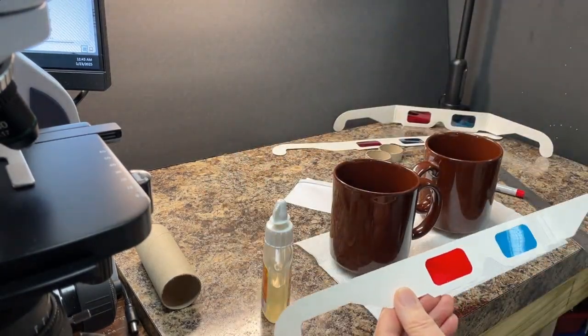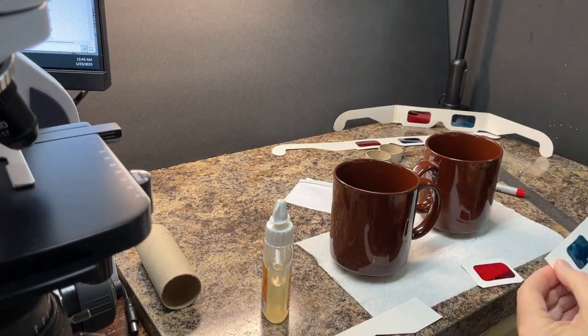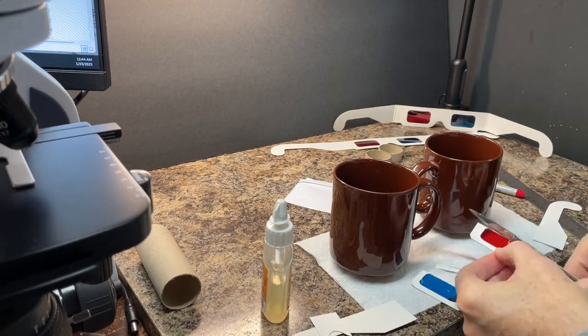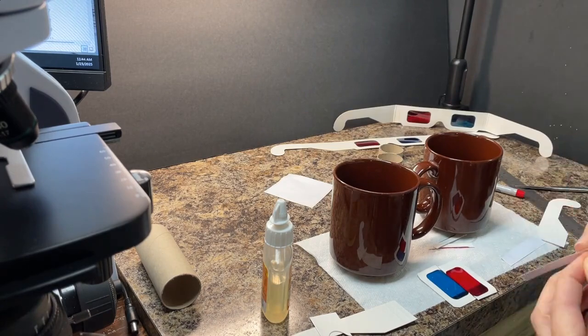To make the illuminator filter for the Anaglyph system, cut the red and blue filters out of 1 pair of the cardboard glasses, leaving the frame on 3 sides as shown. Tape them together edge to edge.